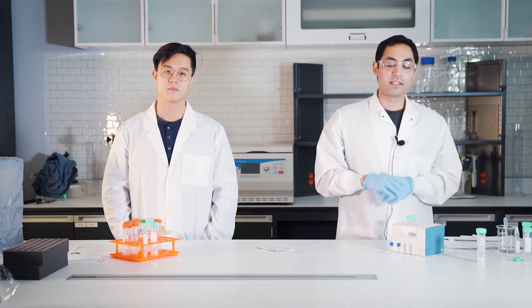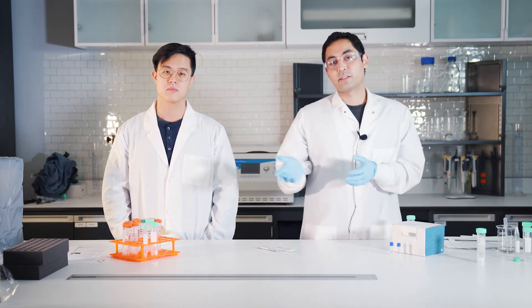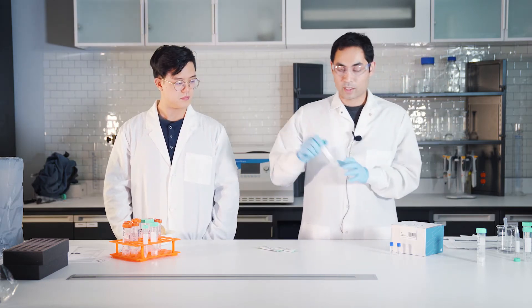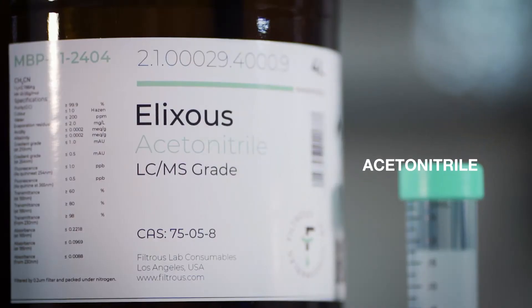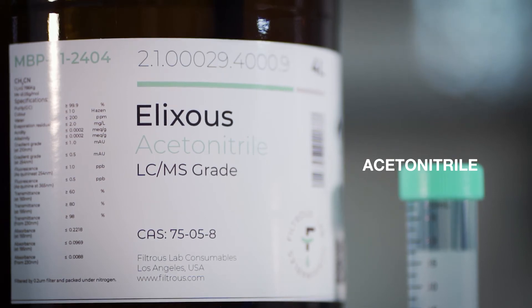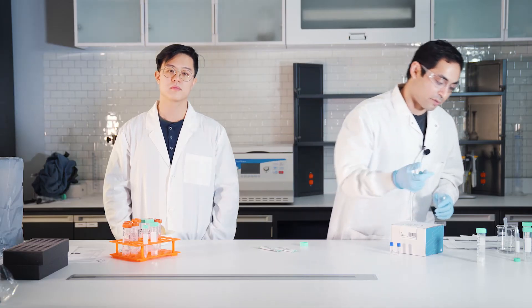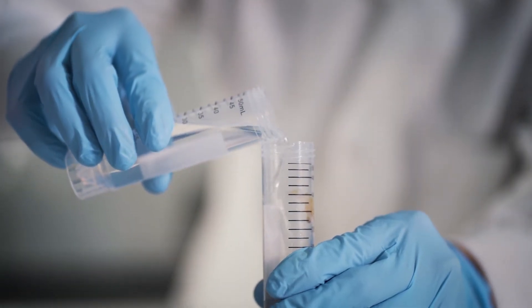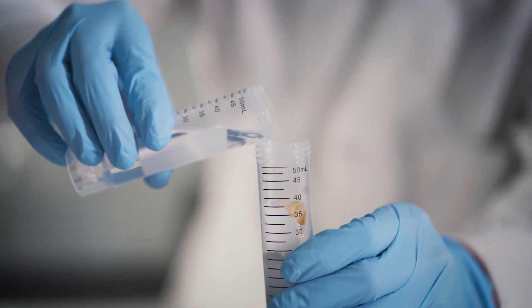We have some sample here, we're going to add acetonitrile. Usually you can have one of those bottle dispensers, that's really handy, but for now I'm just going to pour some in. And then lastly you're going to add your QuEChERS salt, pour it in.